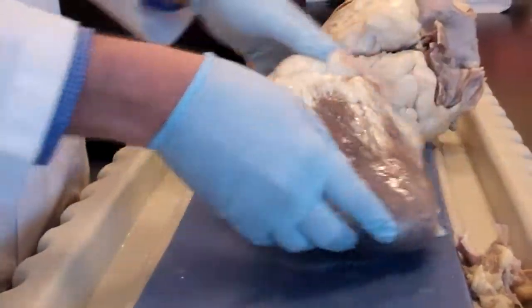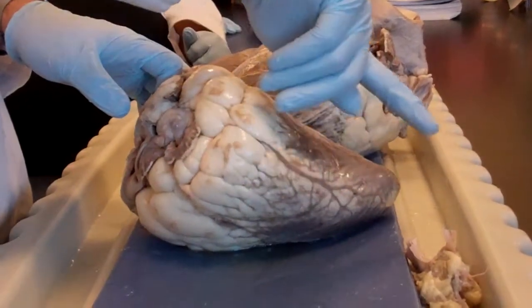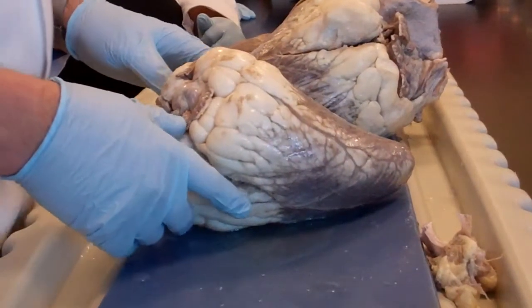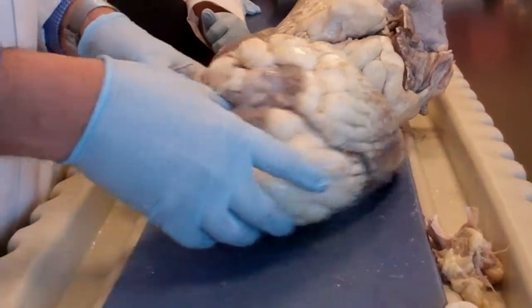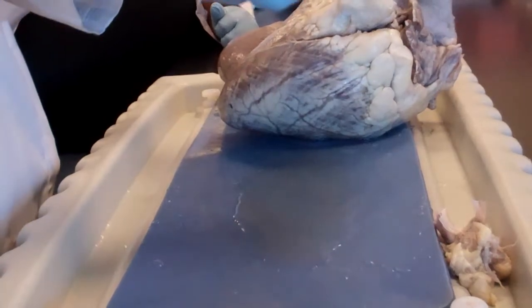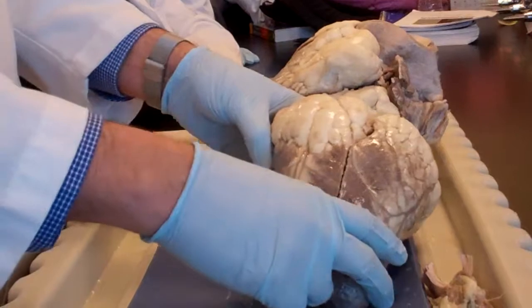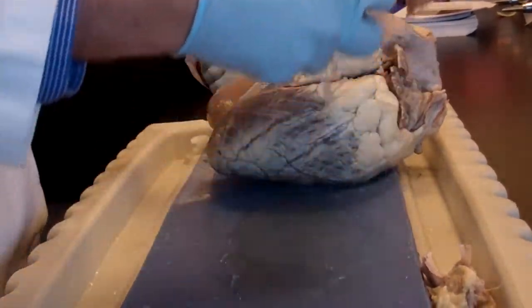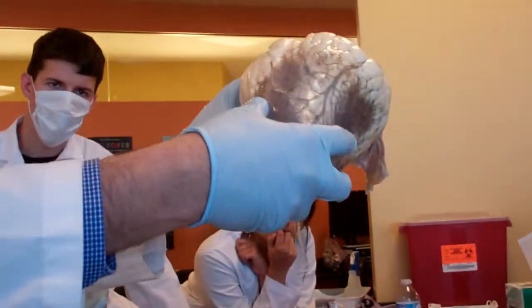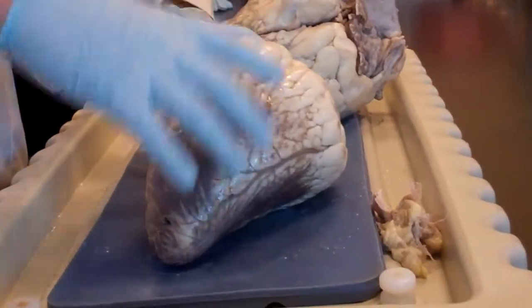Okay? Yes? And even the apex is towards the right, towards the other side. Okay? Anatomically. Alright? So if you put the heart this way, anatomically, it's pointing to the heart, to the right. It doesn't make sense. Alright? So you have to put it this way. This way. This is the anterior, this is posterior. Okay? And you look at it anatomically. Make sense? Now we know the most important thing.